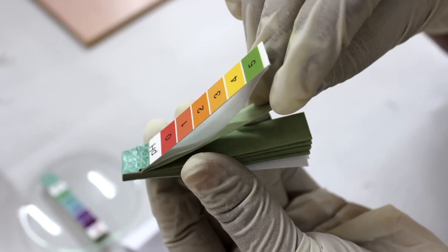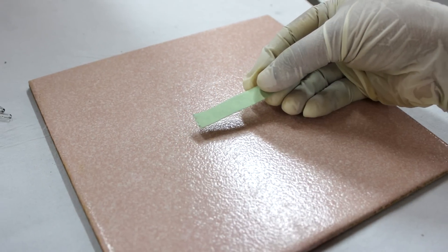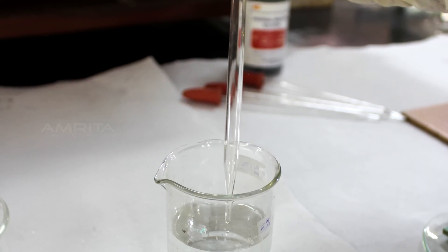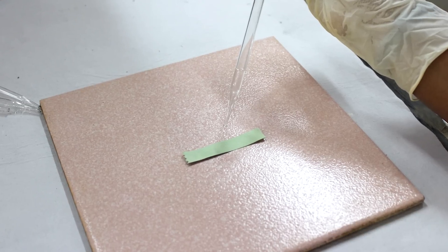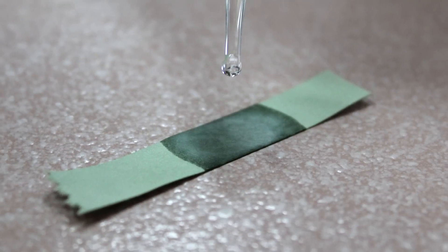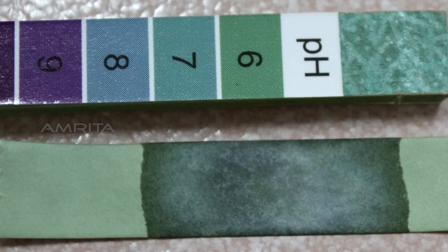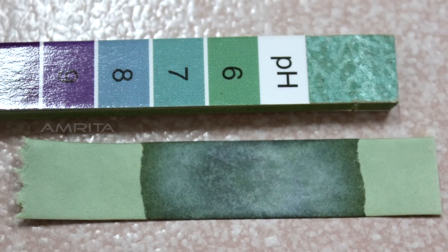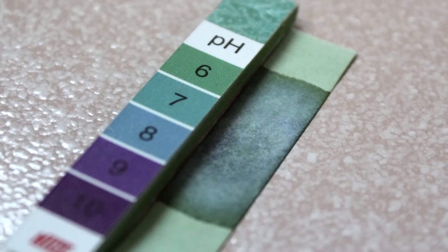Take a strip of pH paper and place it on the tile. Take a drop of common salt solution from the beaker using a dropper and pour it over the pH paper placed on the tile. Observe the colour produced and compare it with the different colour shades of the standard colour pH chart and note down the pH value.